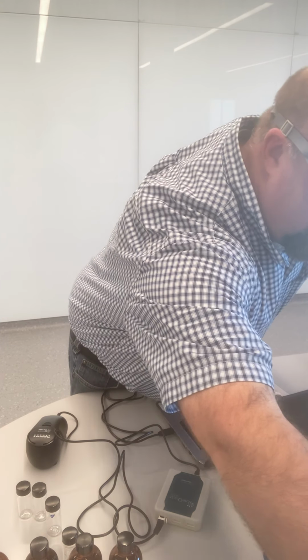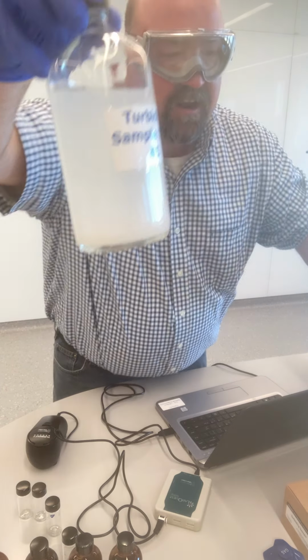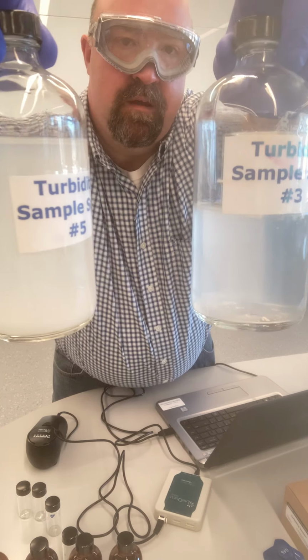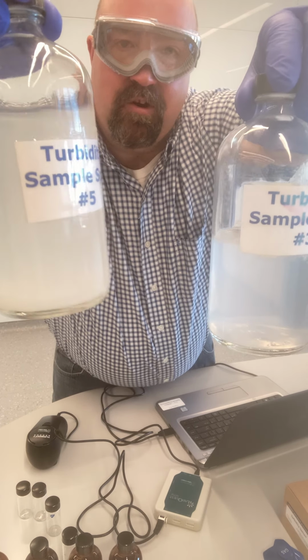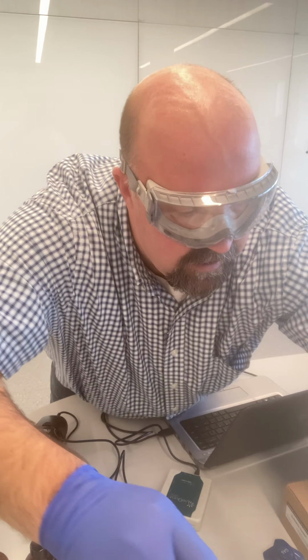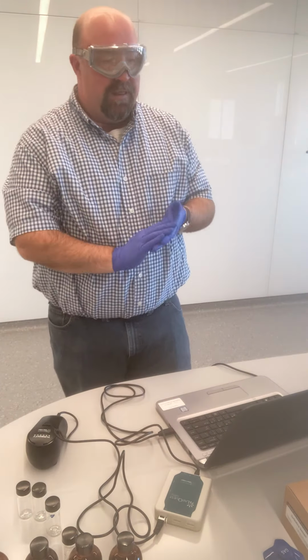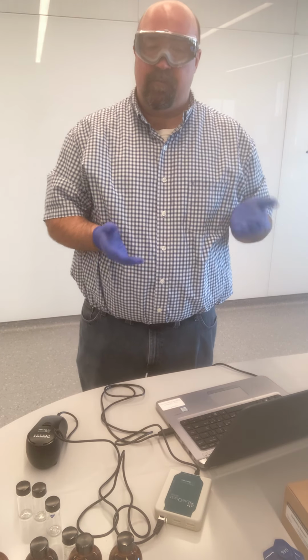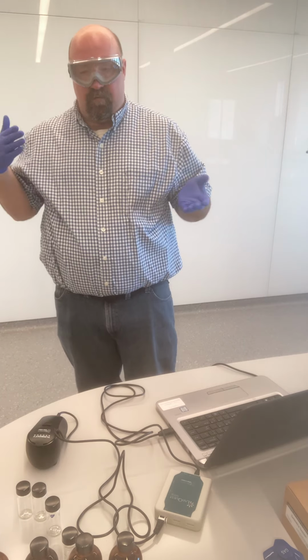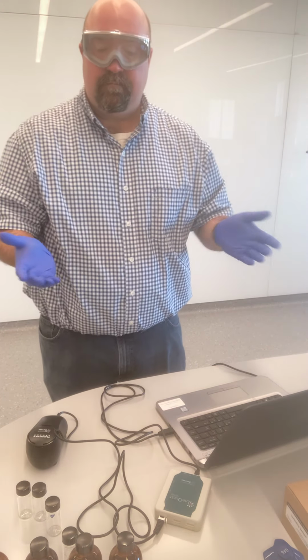And so for instance, if we look at sample spot 5 and what that actually looks like compared to something like sample spot 3, so we're quantifying how much cloudier this is than what this one is. And in order to measure turbidity, we use something called nephelometric turbidity units, or NTUs. And so really what we're looking at is how much of the light is able to pass through the sample, and look at quantifying that.